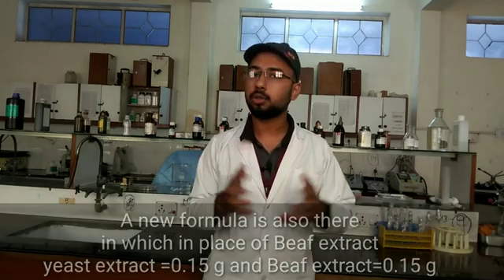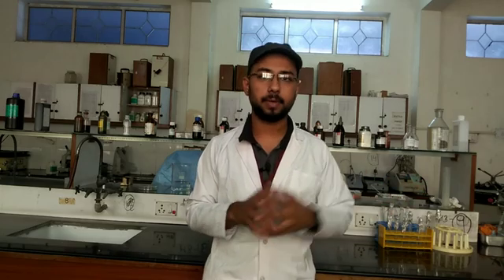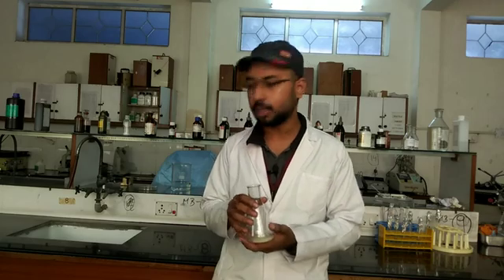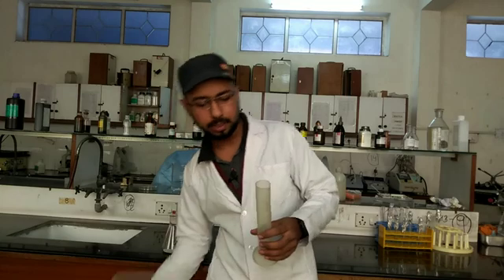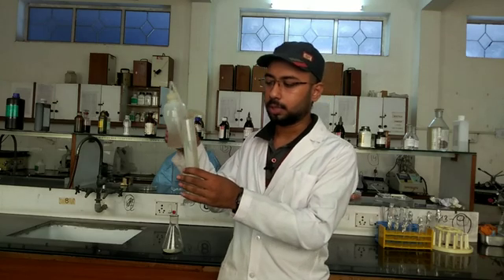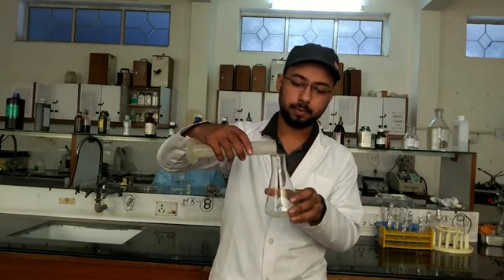How to prepare nutrient broth: First, we weigh out all the ingredients on a weighing balance. Then we take a conical flask and add all the ingredients in the proper weighed amounts. After that, we measure 100 ml of water in a measuring cylinder and add it to the flask.